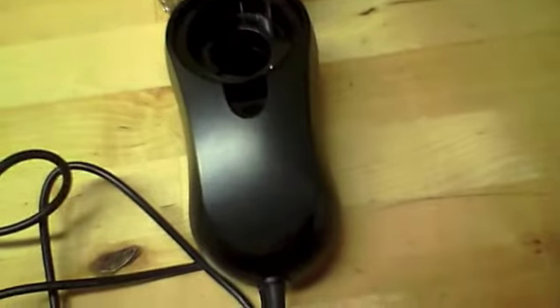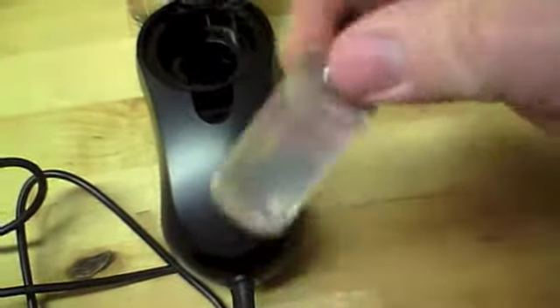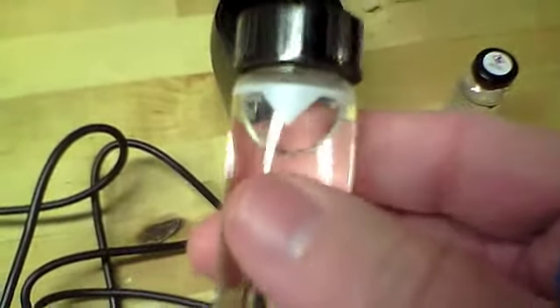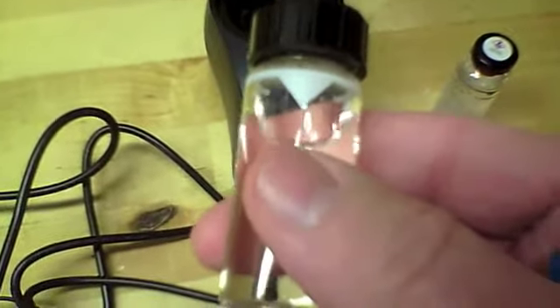When you come up to the table, you'll see all of these things. You'll see the turbidity sensor. You'll see the turbidity blank. You don't want to try and open this. It is one that we need and that comes from the company. I've already prepared one sample, but it's really not my sample. It's the blank. It's going to be one of the comparative tools that this machine will calibrate itself to, so that we can ultimately test our Fenton River and well water turbidity with.